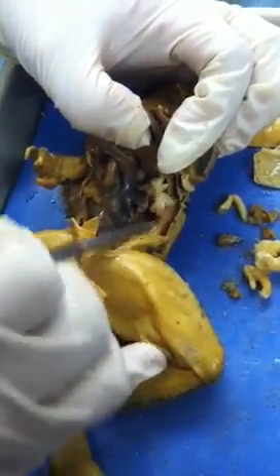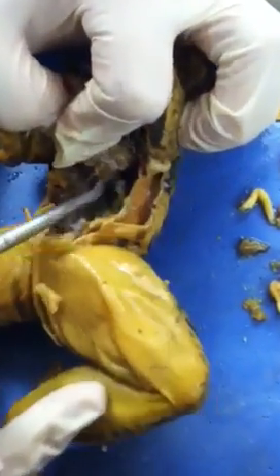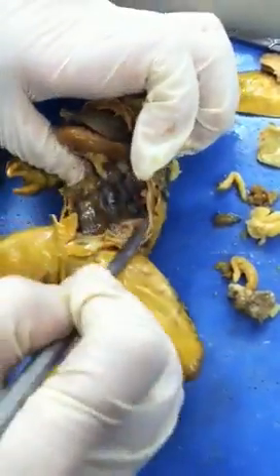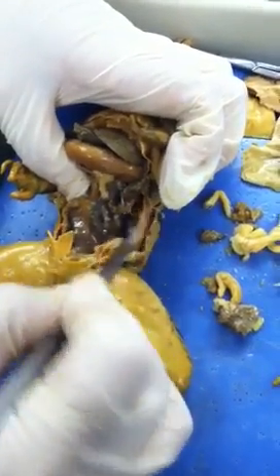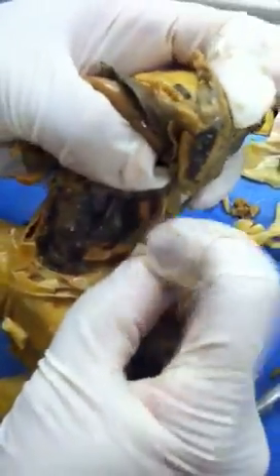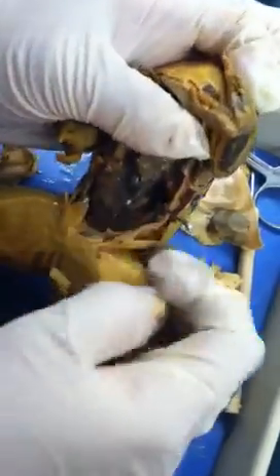If you dig deeper, all the way to the back, you will see an organ completely different from the spleen. Right here, attached to the backbone — it's kind of dark in color. That one is the kidney. There's one on each side. Pay attention: if the exam asks about an organ attached to the backbone at the very back, that's the kidney.